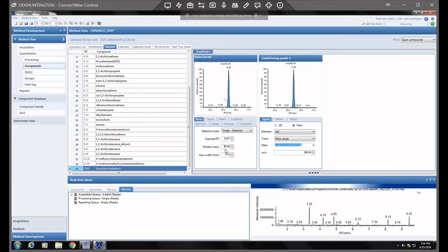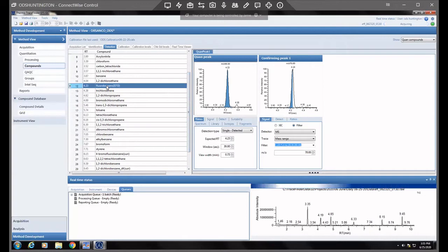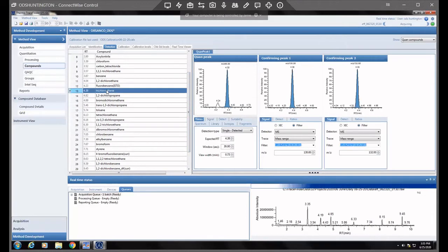This window is basically saying at 1067 plus or minus 30 seconds is where you'll find this peak. So you can shorten that window, especially if you have really close eluting compounds. I think 30 is kind of standard, but there's definitely some that come off really close together. Let me see if I can find an example. 423 and 438. Obviously 23 and 38 seconds are pretty close together, but they both have a 30 second window.